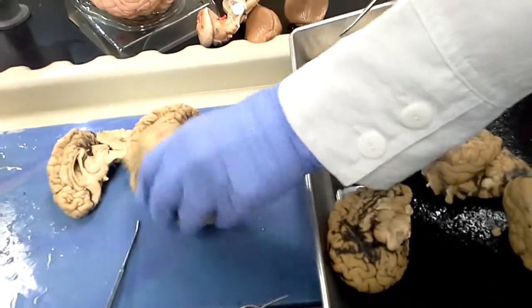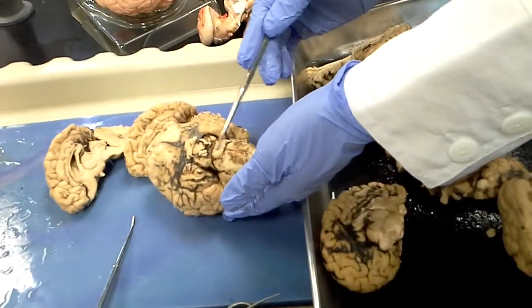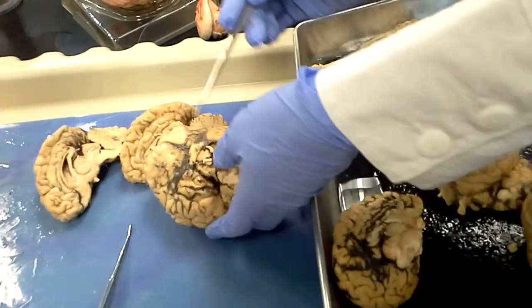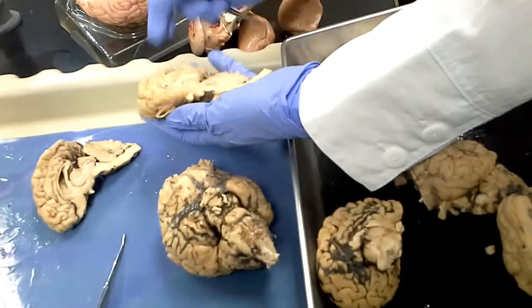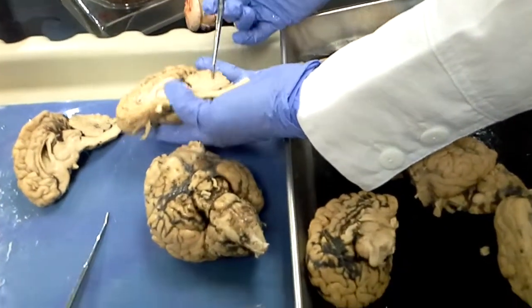Metencephalon, also known as basically the pons, the biggest bulge that we see, and the cerebellum behind it. So pons is the bulge. Cerebellum is the big folded structure behind it. In cross-section here, sagittal view, you can see some of pons here, cerebellum here.